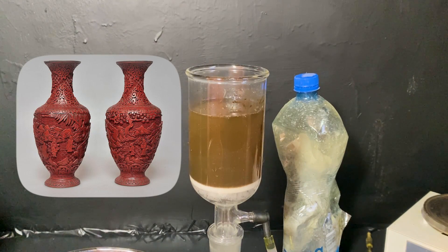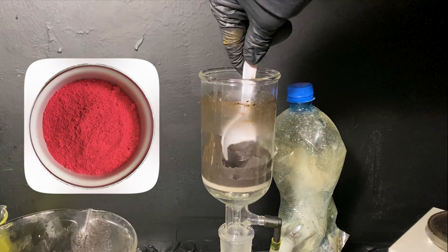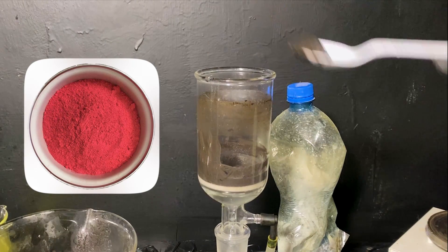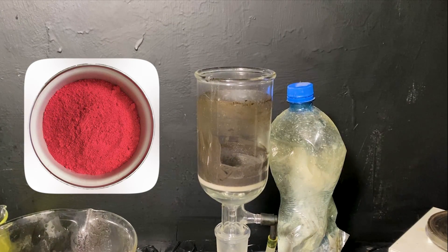For that reason, it was also used as a red pigment in ancient times. And to be honest, it has a really nice red color, especially when it's milled. Eventually, we're left with mercury sulfide mud, and now we can start pulling out all the mercury from it.